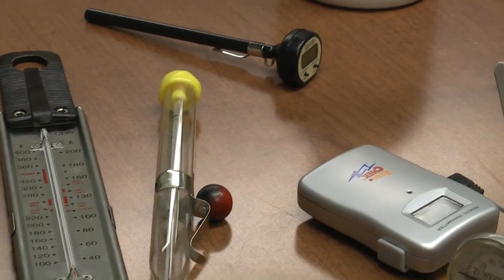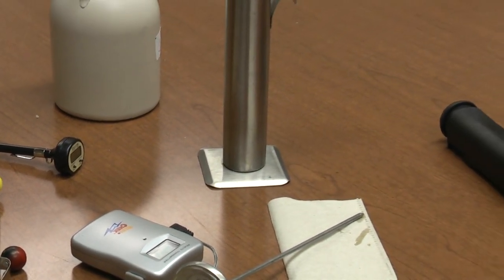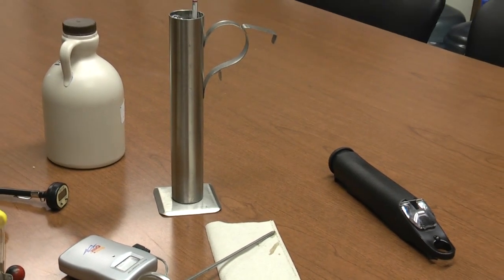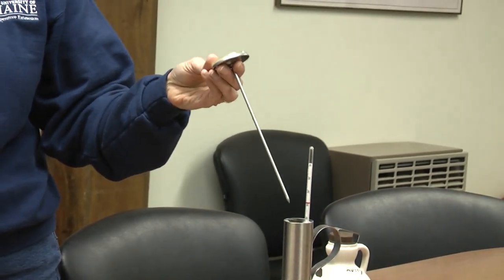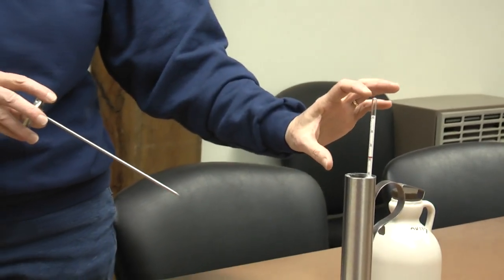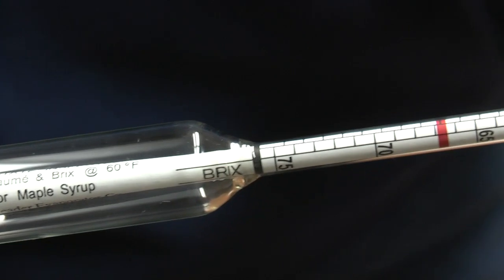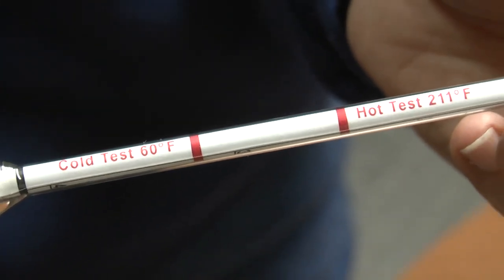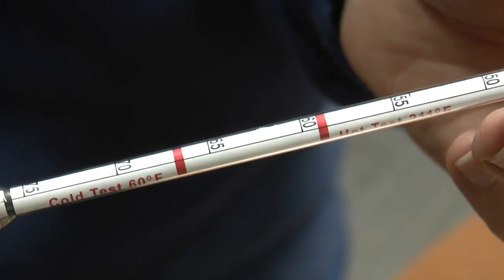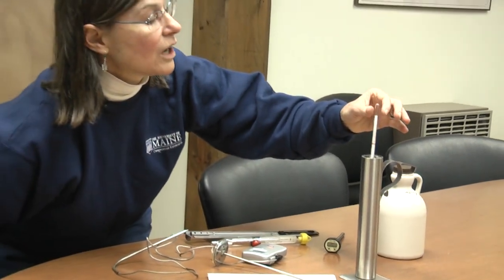You can use a hydrometer and a hydrometer cup — that will run maybe $20 for the hydrometer cup and $15 to $20 for the hydrometer, and that's the cheapest choice. You need to use some kind of dial thermometer with the syrup in the cup. Your hydrometer is calibrated at either 60 degrees or 68 degrees, and it will say on the stem on the paper. Also note there are two red lines on your hydrometer — one's a hot test and one's a cold test. We are right at that cold test line and so our syrup is 66.9 Brix, so it's perfect.